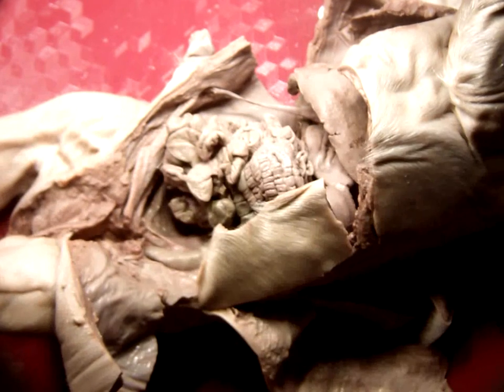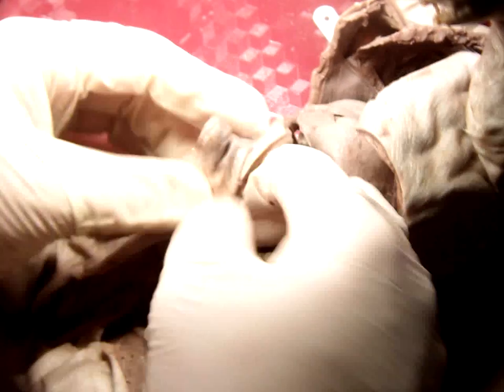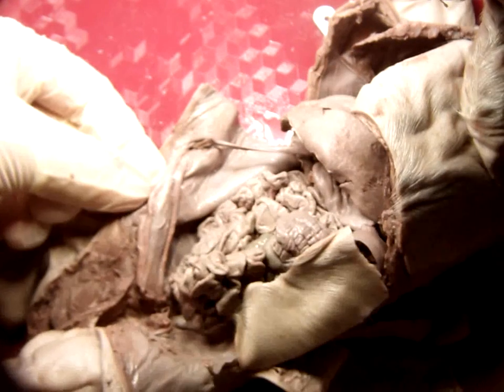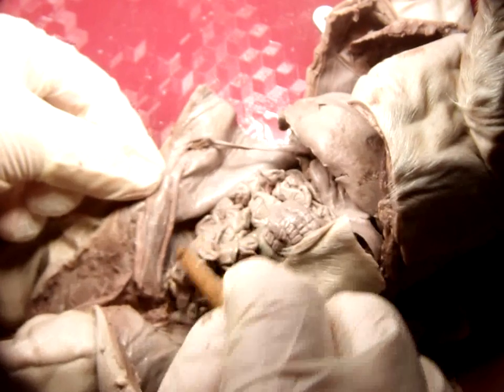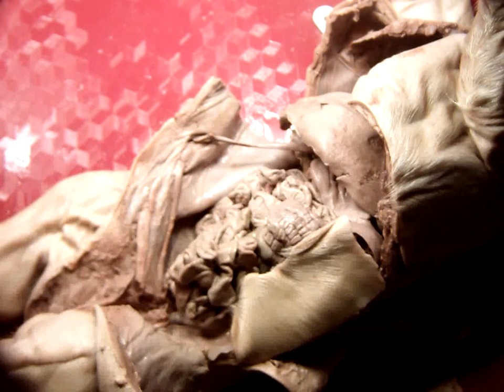Can we go over the bladder? Sure, yeah. Bladder is, like I said, kind of weird. You have to find where the umbilical cord attaches right there. Follow those tubes down here, and it's in between these two blood vessels. The bladder is this long, skinny structure right here. Yeah. Okay, other questions? Folks, it's weird.